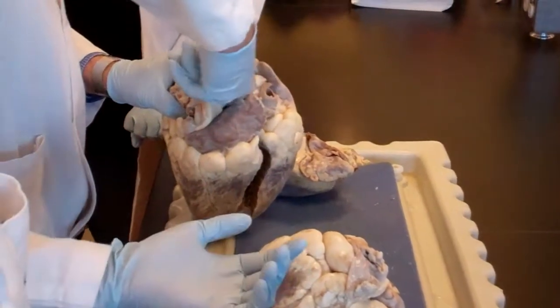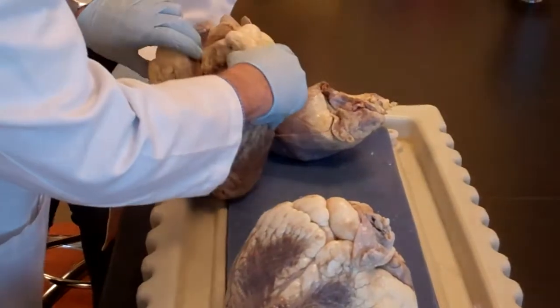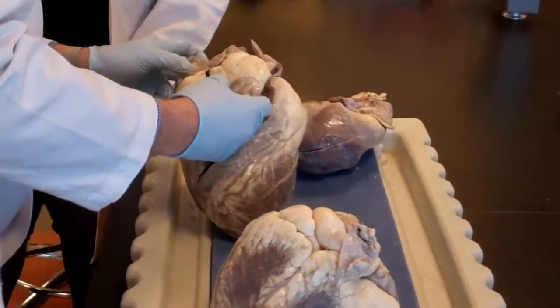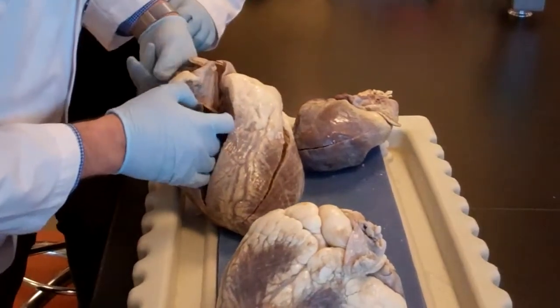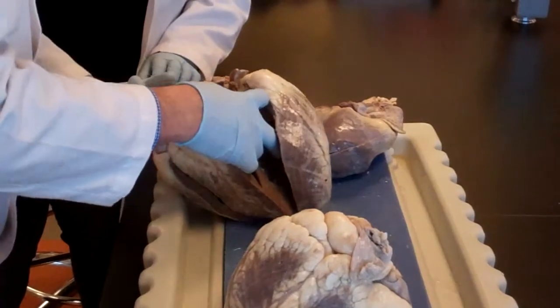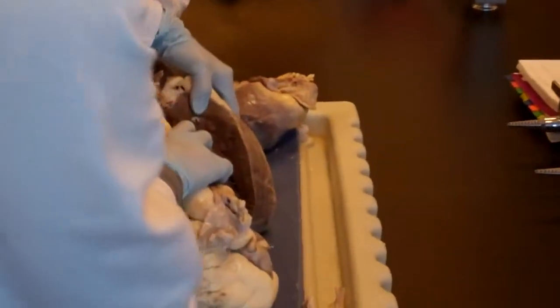All right, I'm going to show it to you from this side. Okay. And here are the valves from here. If you want to open it this way, then please. And leave my finger. Forget about it. Okay. You see where my finger is? You don't.